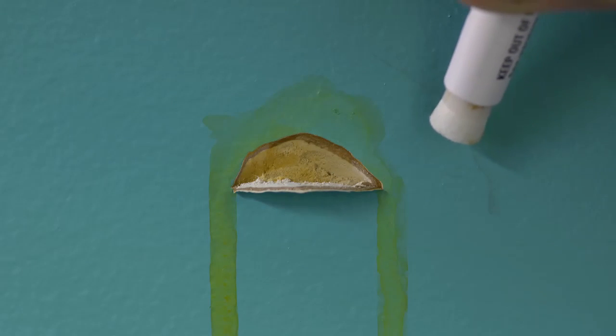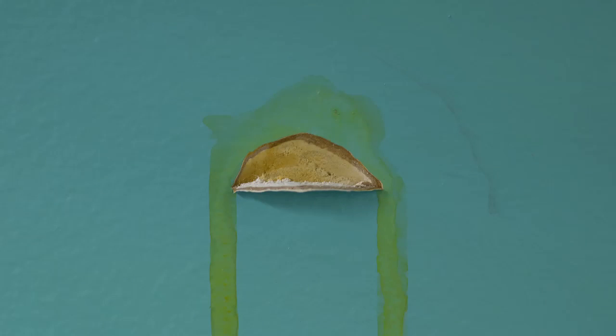If the edges of the cut area and the edges of the flap remain unchanged after 30 seconds, lead has not been detected.